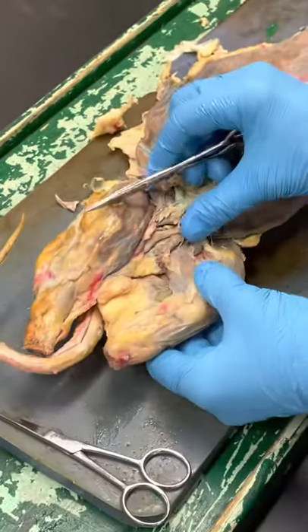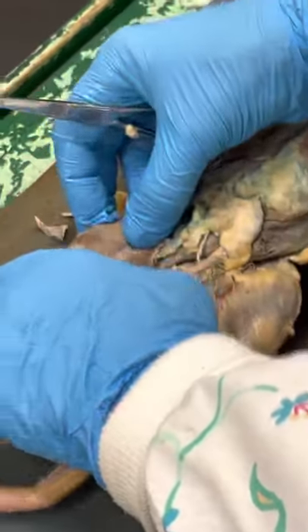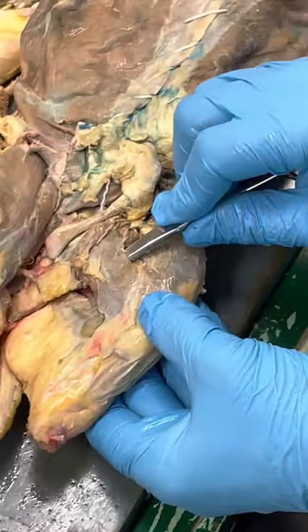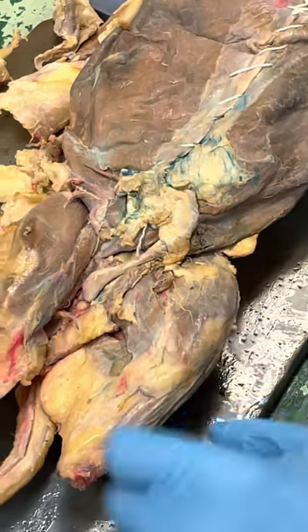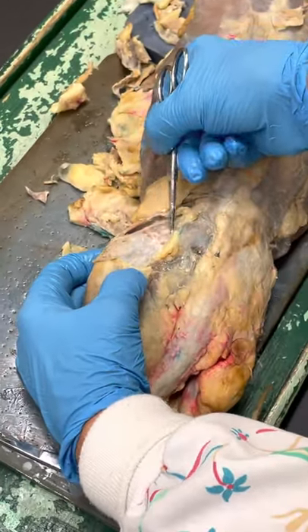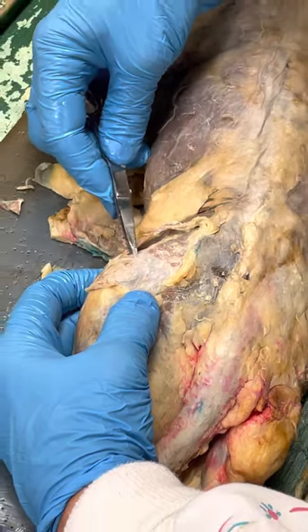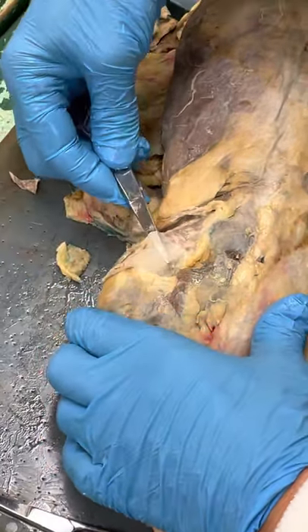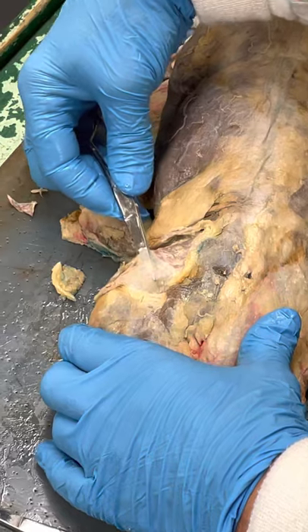I'll just pick on a couple of leg muscles. This muscle right here is gracilis, and then this broad one coming down here is sartorius. Coming to the back, what I really wanted to show you was tensor fascia latae — here's the little part of the muscle, and here's the fascia, which is the connective tissue. When I lift up on it, it's super strong — this whole band of fascia. That's the tensor fascia latae, or the IT band, that goes across the top of our leg.